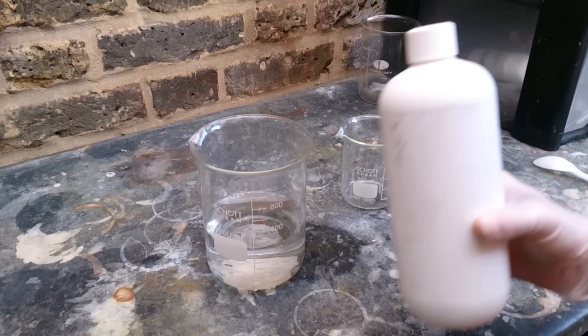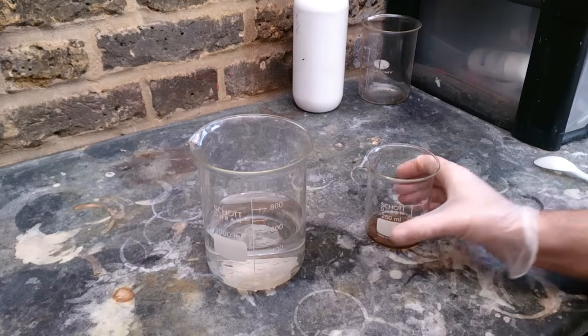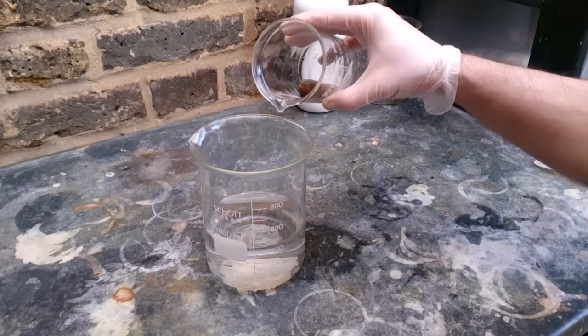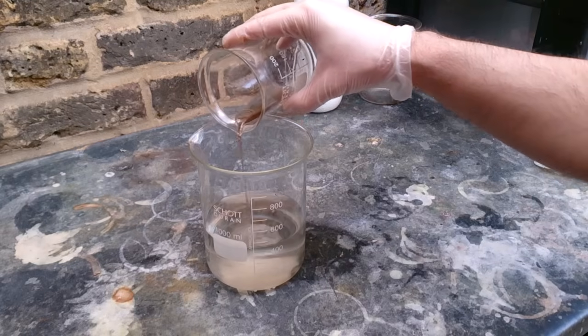I'm using a really dirty toilet cleaner for that purpose. Even though it's a toilet cleaner, when concentrated, you do not want it to get on your skin. You need just a little bit of sulfuric acid — the exact amount is not really critical because it's just a catalyst and it will not go into the reaction itself. Anything between 1 and 10% will do the job.